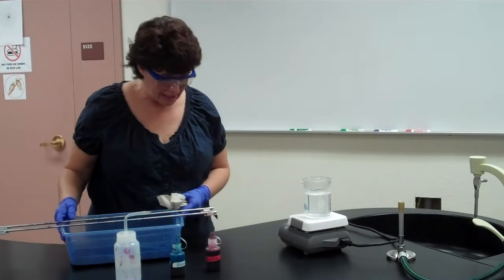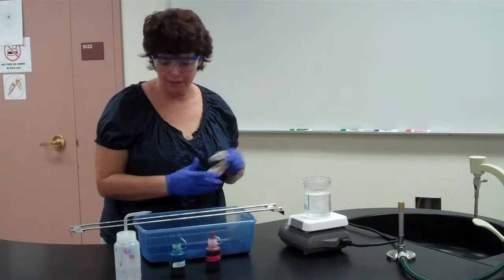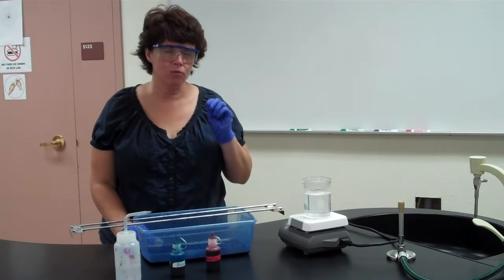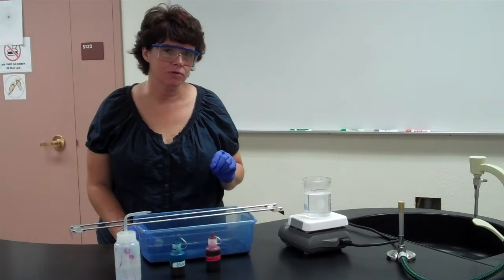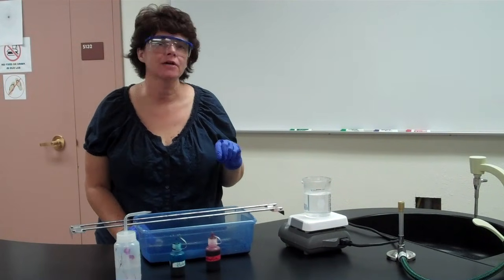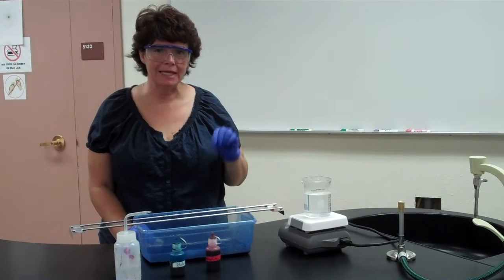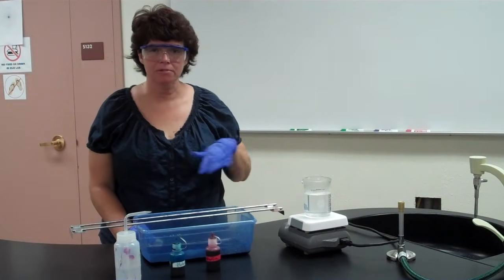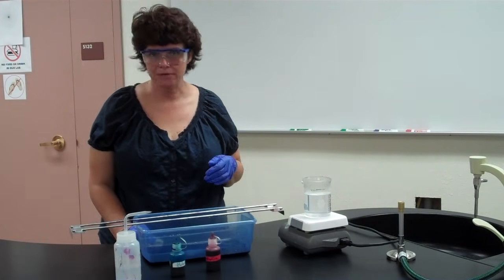So I was saying that at the end of the stain, you're going to have a green endospore and a red cell. Now the endospores may actually be within the cell, or they may have been released. So depending on the age of the culture, if it's early in the life cycle of the culture, they may be inside. If it's late in the life cycle of the bacteria, then it may actually be released. So be prepared to see them either within the cell or outside of the cell.